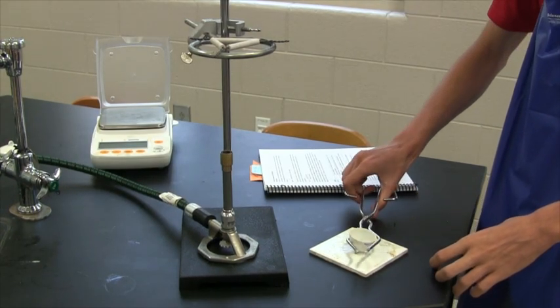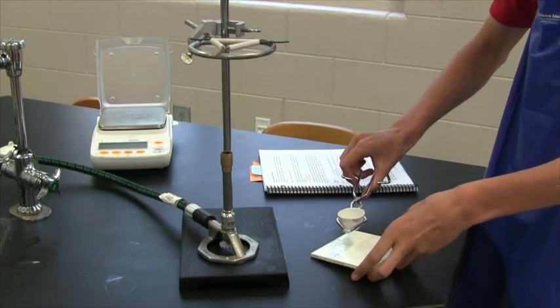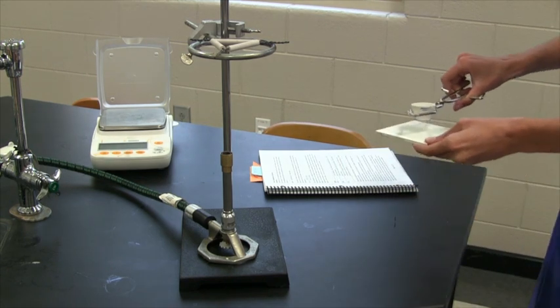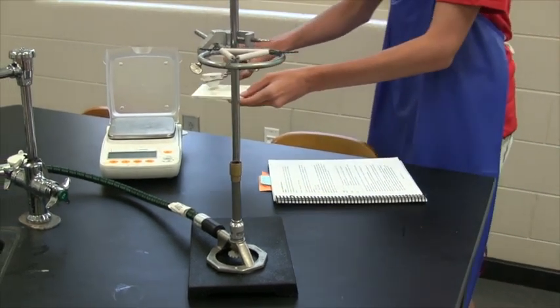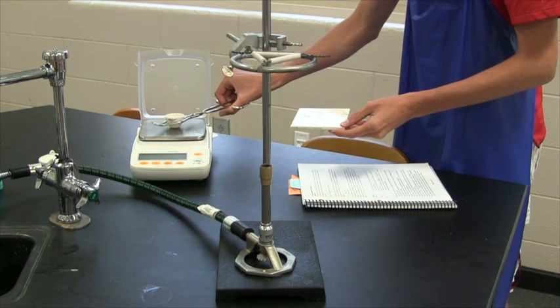After it's done cooling, use the crucible tongs to carry it over the ceramic tile to transport it to the balance. At the balance, you need to find the mass of the cooled crucible.